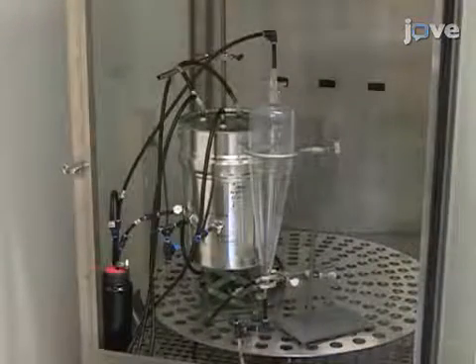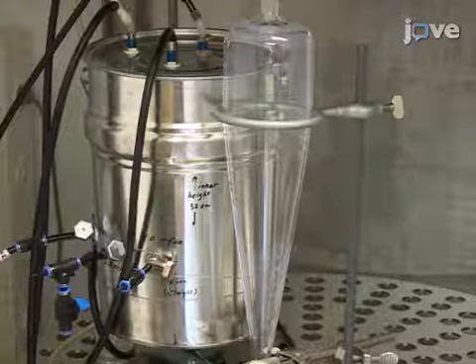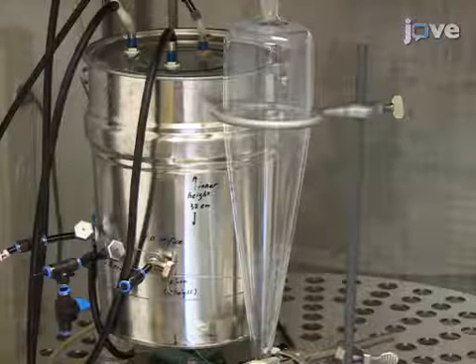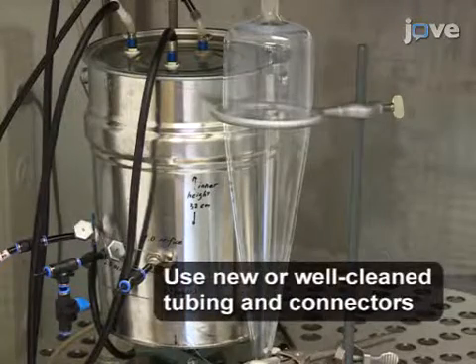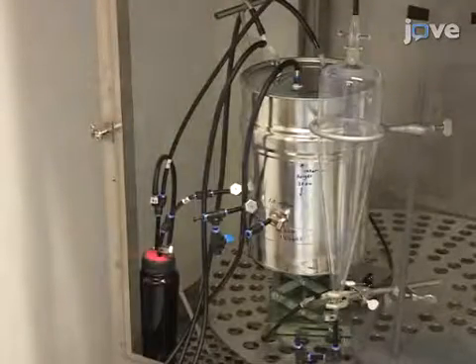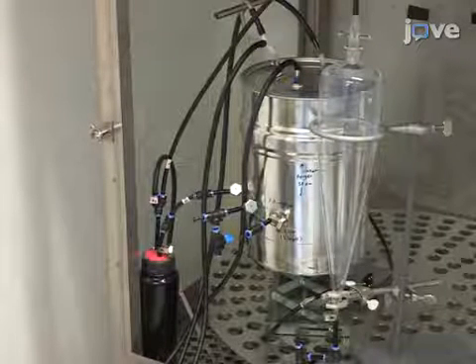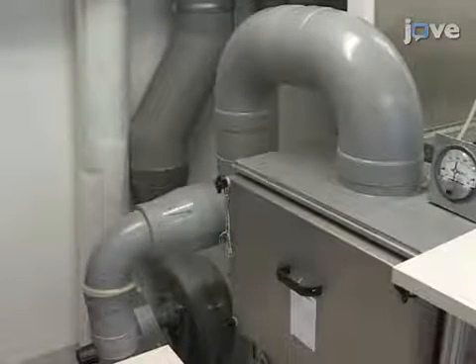The setup for this experiment is inside a ventilation chamber. All of the components are in place to help orient viewers. One principal component is the V-shaped glass aerosol generator, capable of resisting high pressures. Use conductive particle transport tubing to connect this element to a mixing compartment — a 1-liter, grounded metallic bottle. More conductive particle tubing connects the mixing compartment to the measurement chamber, a grounded 12-liter metallic drum. Particle samples are drawn from its top, and extra flow is directed into a filtration system.